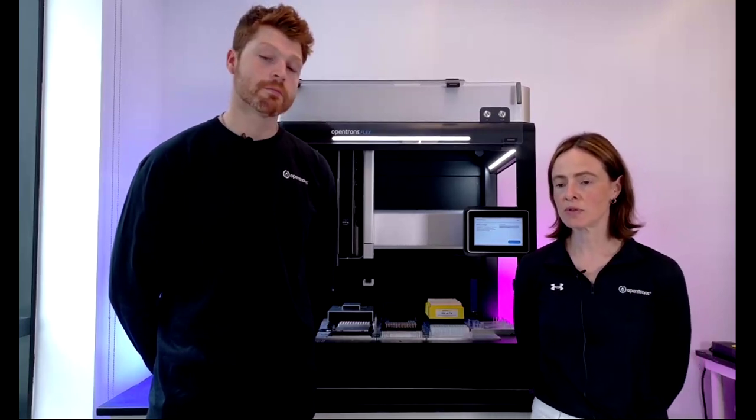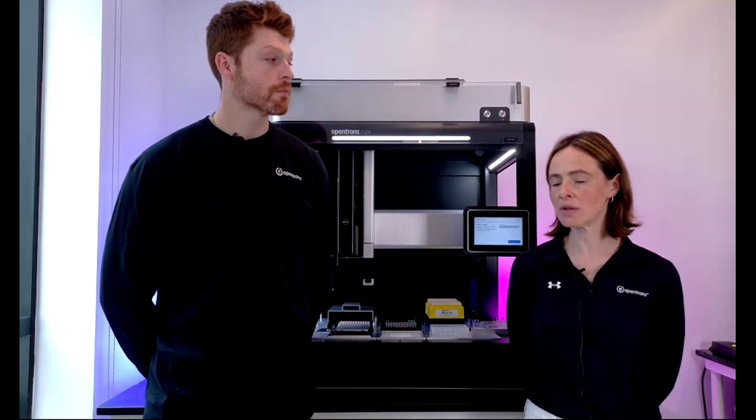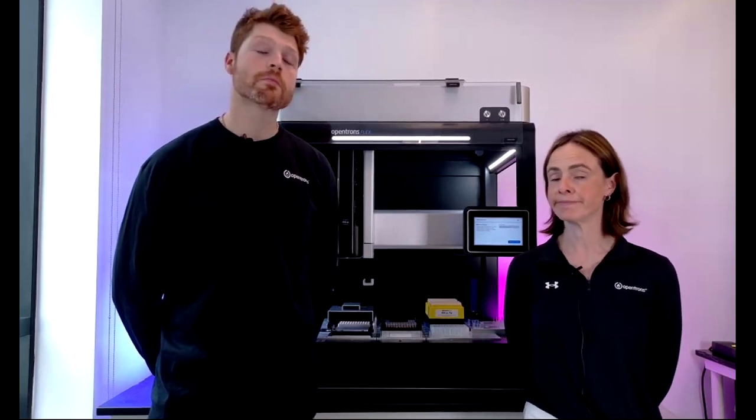But we do recommend an annual PM, which you can get as part of a service contract, and that involves swapping out some pipettes and other features as well. But that's part of a service contract, not routine maintenance that you necessarily need to do yourself on a day-to-day or week-to-week basis.